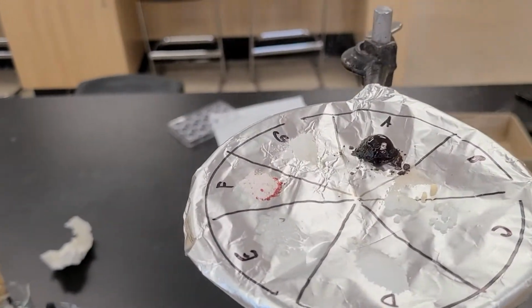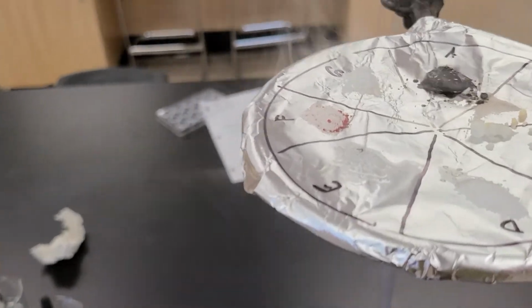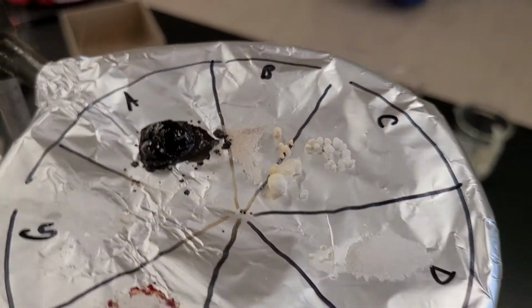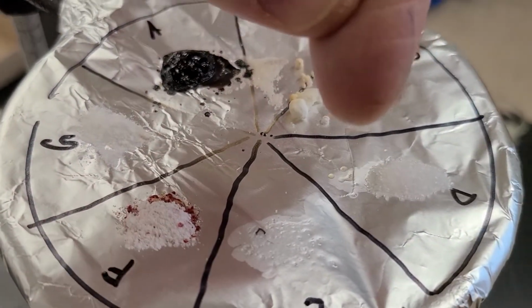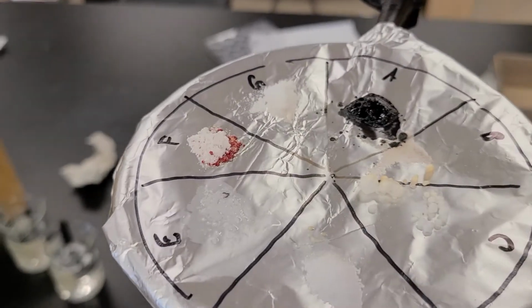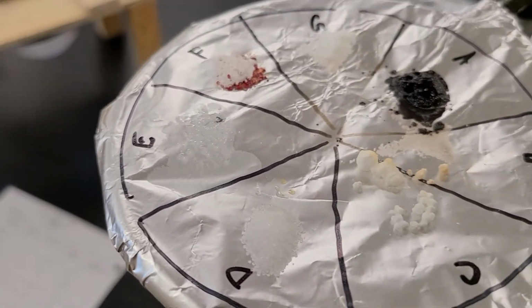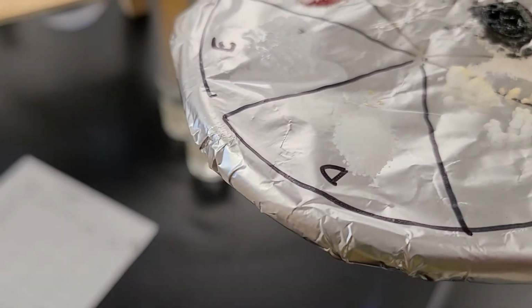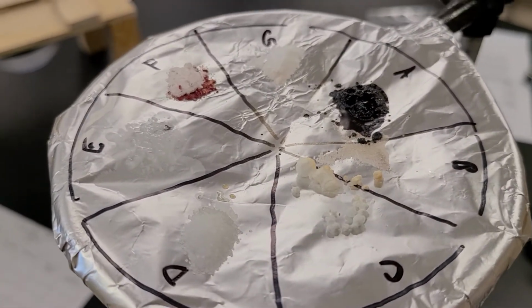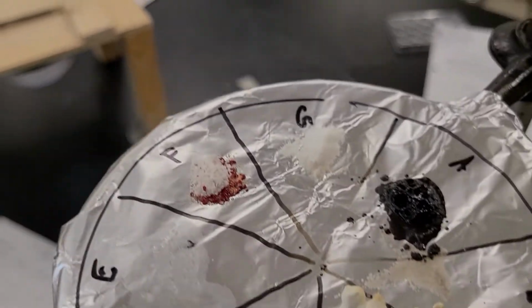Whew, we're getting smoky. So you can write down F and D. D, if we look at D right there, we could see some melting action there as well. And of course, remembering the identity of A, that makes sense why it's turning that color. C isn't melting. B isn't melting. And the last one, G, it's not melting either.